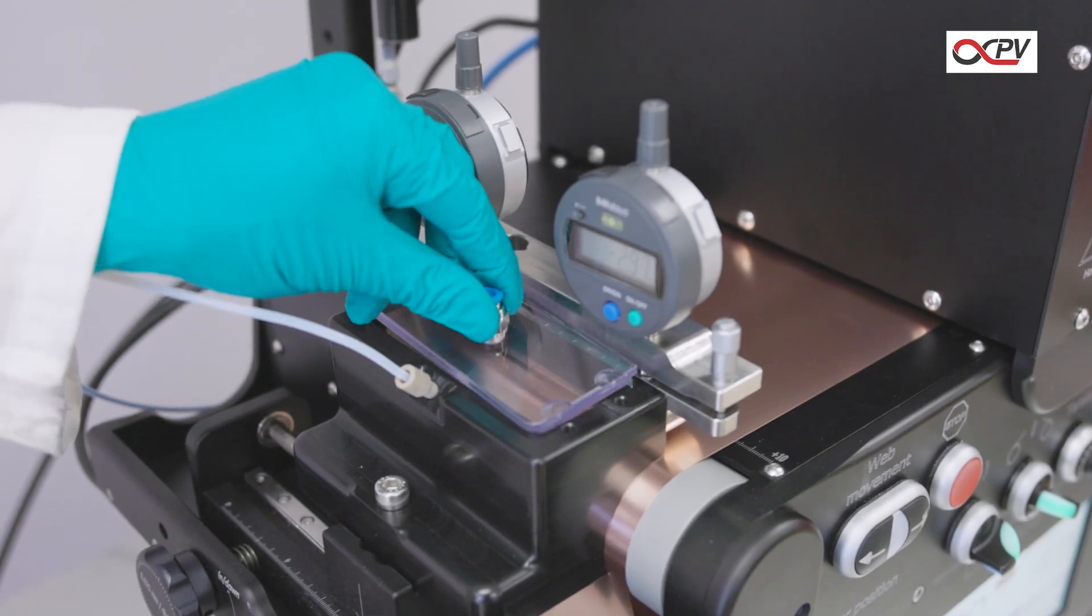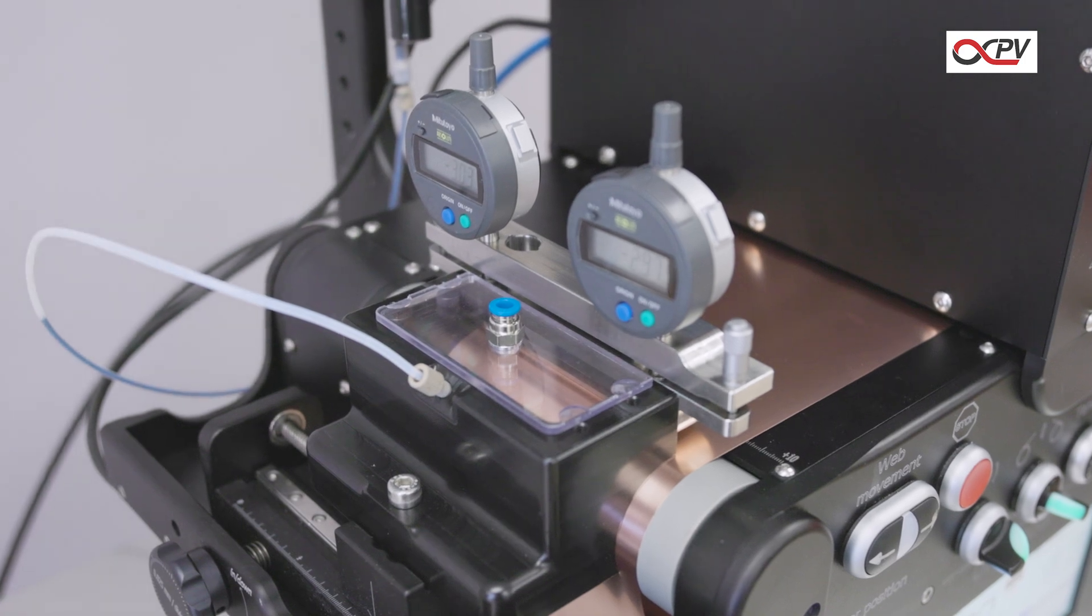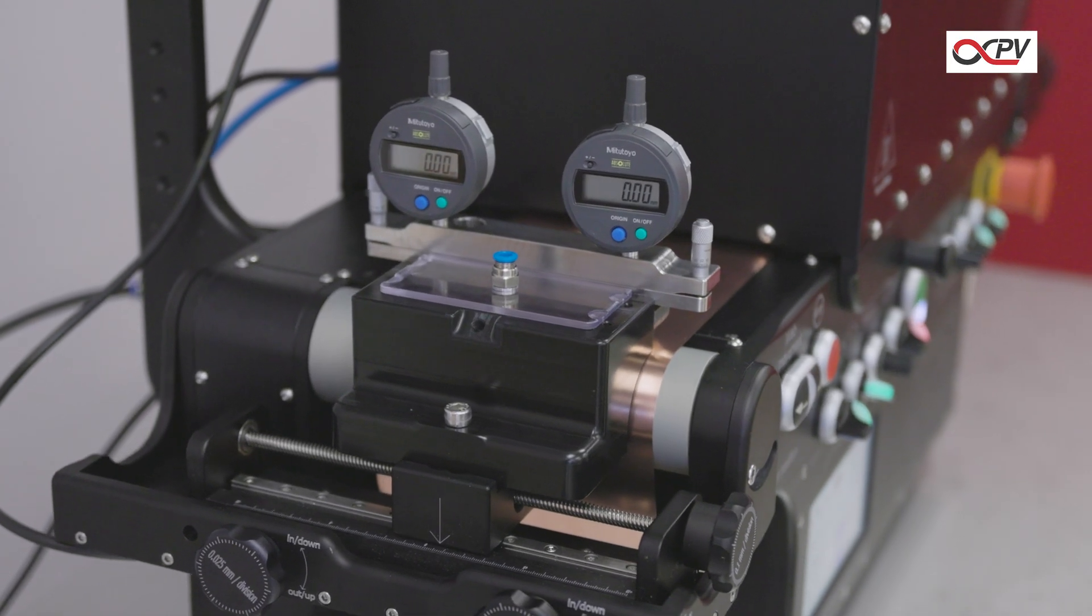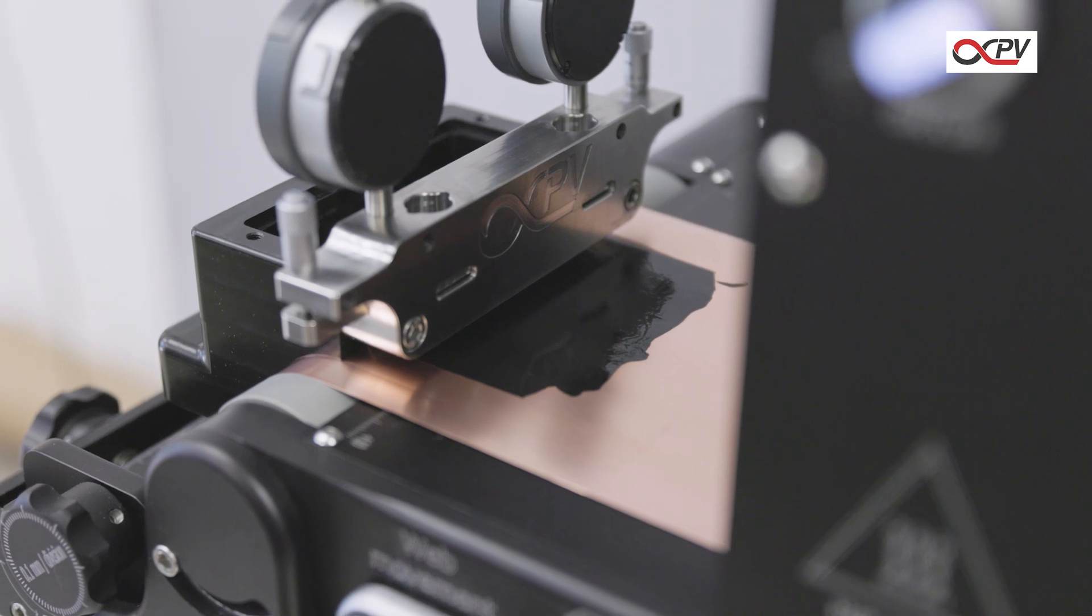Attach the lid to enable operation under an inert gas atmosphere. With everything in place, begin coating—consistently, precisely, and repeatably.